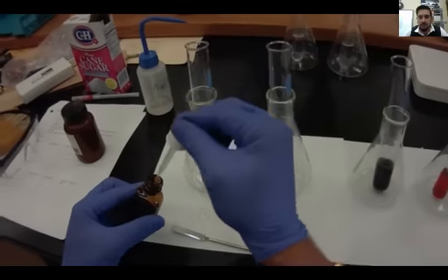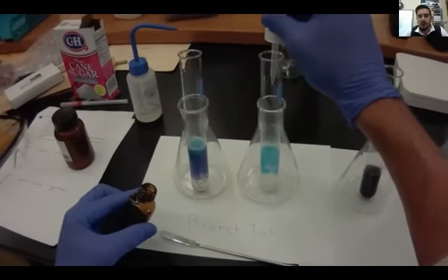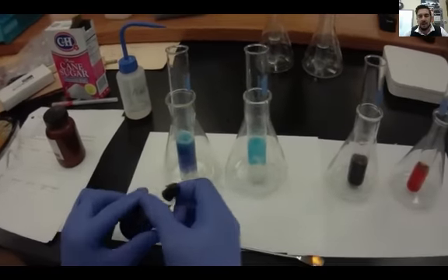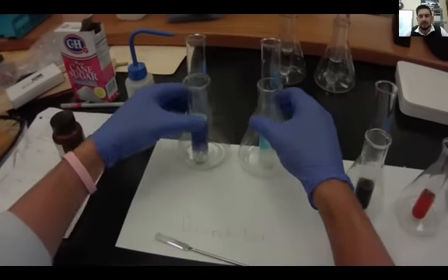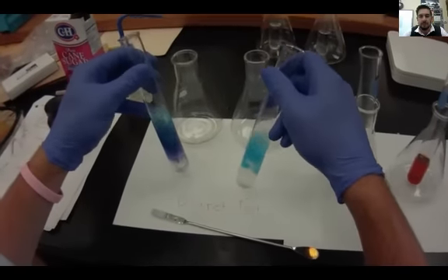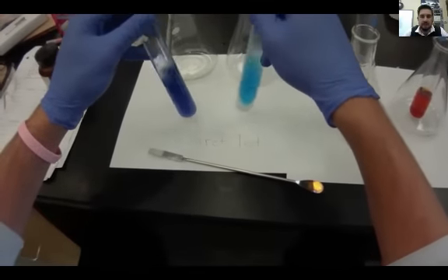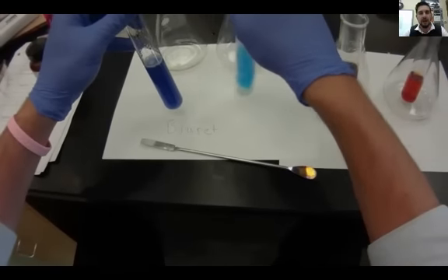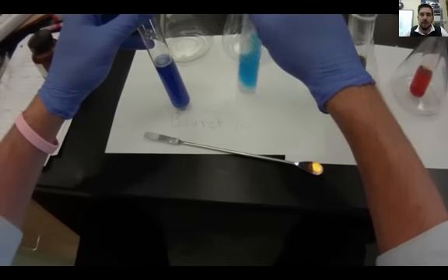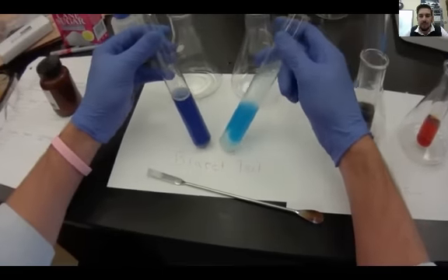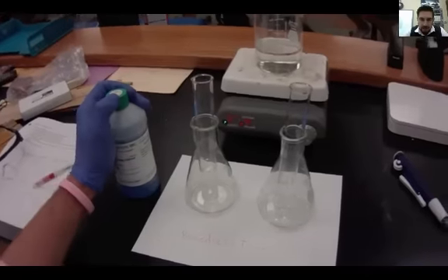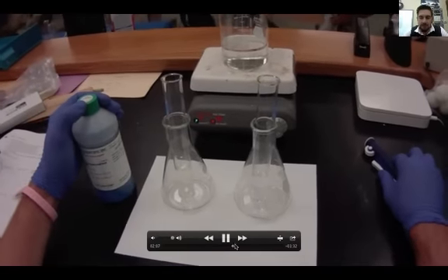I've added my copper sulfate. I'm going to take a look at both these tubes and shake them up a little bit. Now if you notice, the one on the left is very purple, almost matches my glove. That is a positive. The one on the right still remains kind of blue. It is definitely a positive on the left.